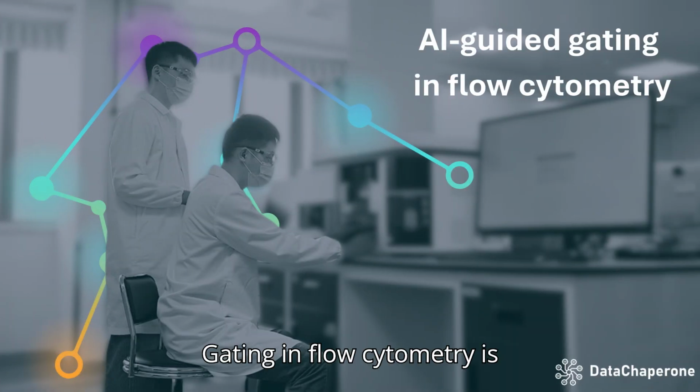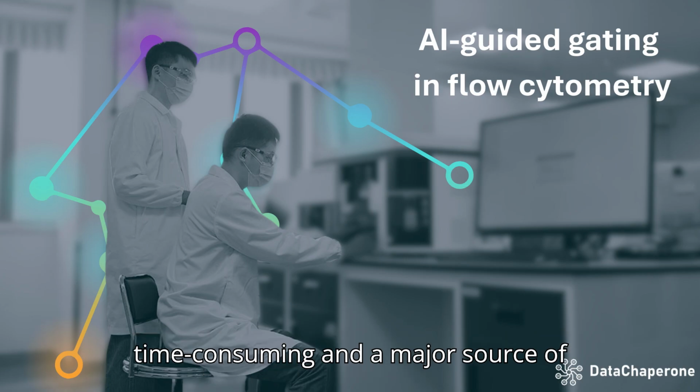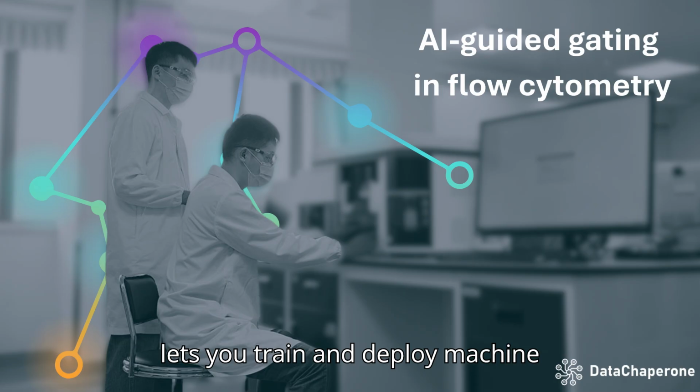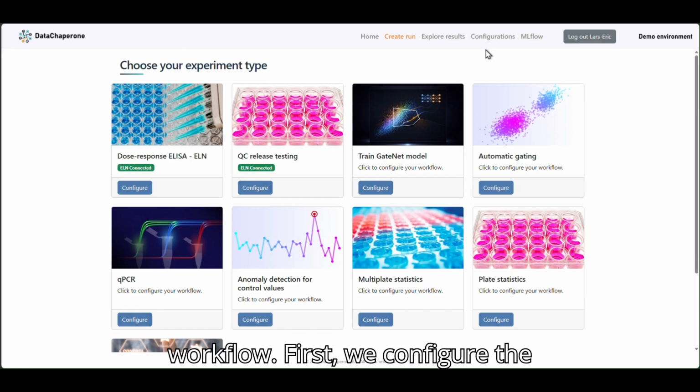Gating in flow cytometry is time-consuming and a major source of subjectivity. Here's how DataChaperone lets you train and deploy machine learning models to automate gating. We start with the model training workflow.